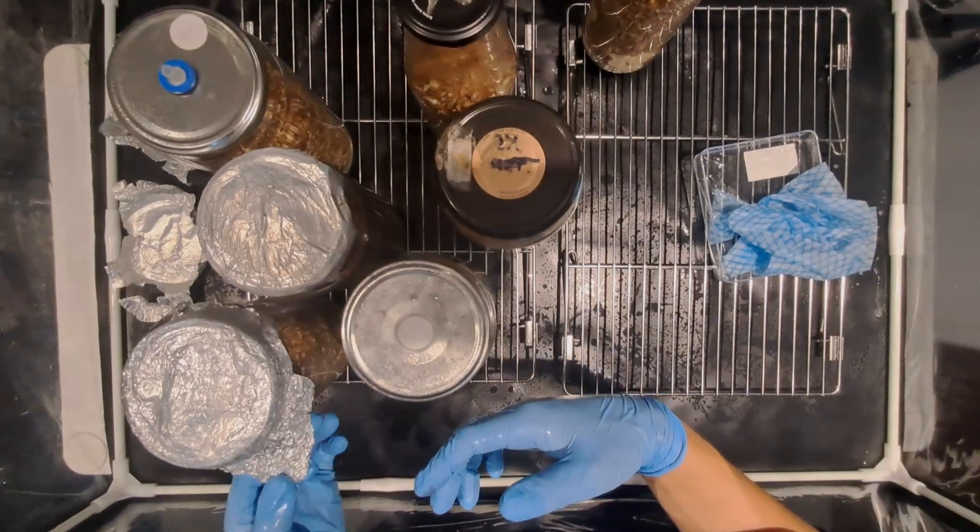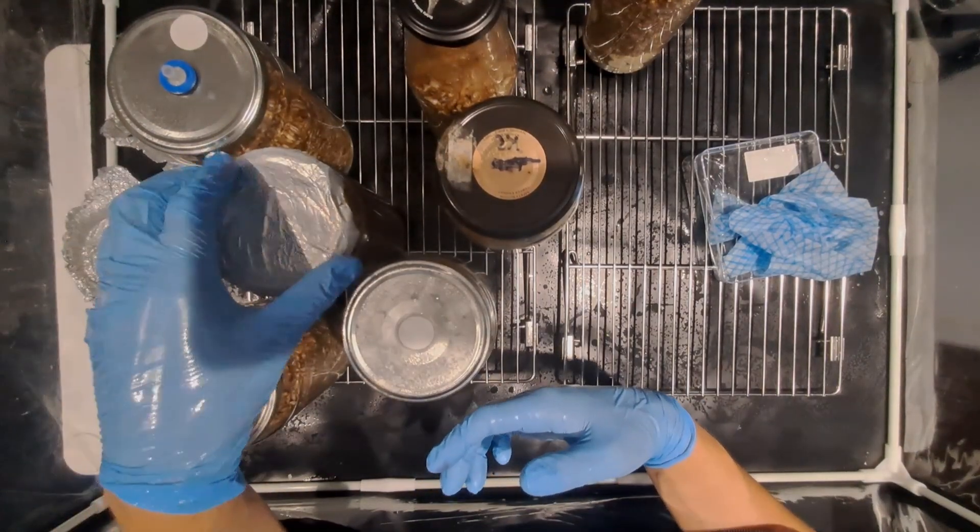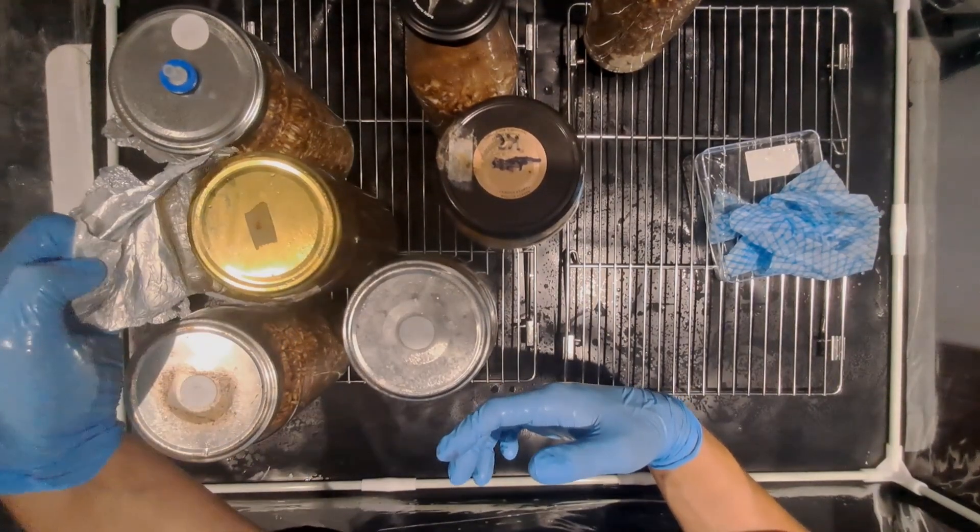Remove the tin foil from the lids of all the jars and then just place them off to the side so that they're not in your way.